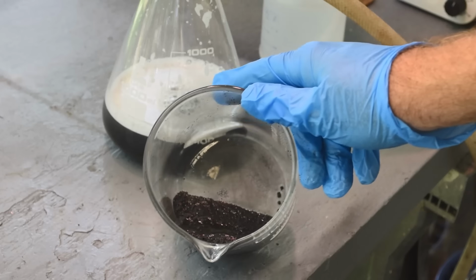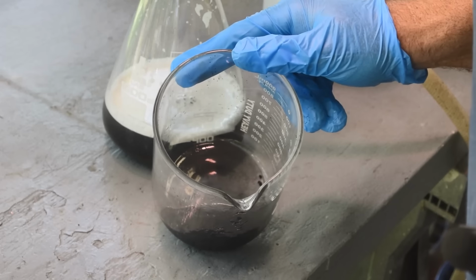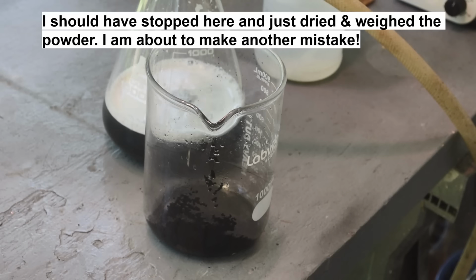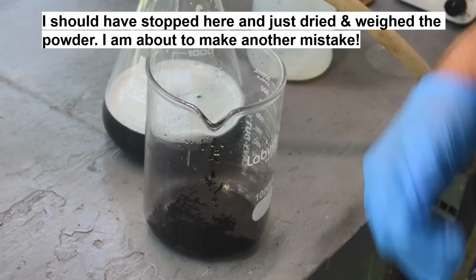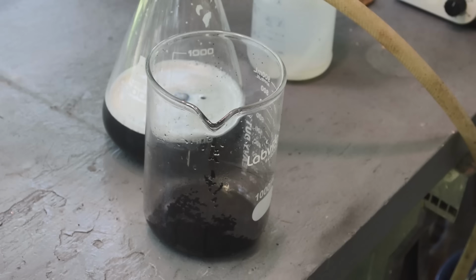All right. That went right through that damn filter. It's hardly even discolored. That's crazy. All right. Let me get the rest of this into the filter and wash it with a little water, and then we'll pull the filter out. I'll get the other filter too that I ran the stuff through, and we'll put them together. We'll put them in a crucible dish, and we'll melt the palladium and see how much we got.